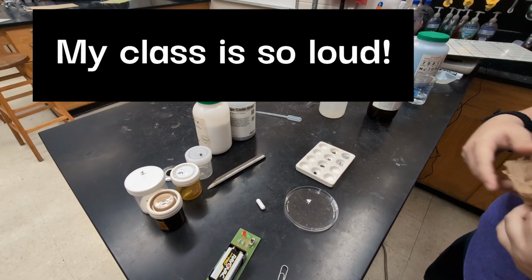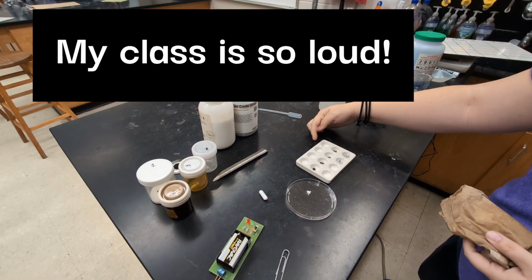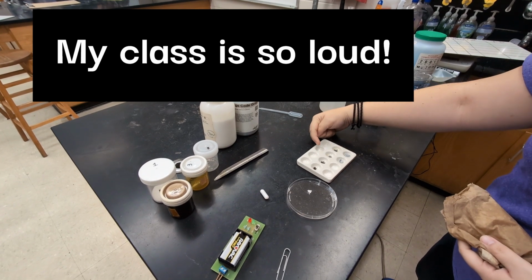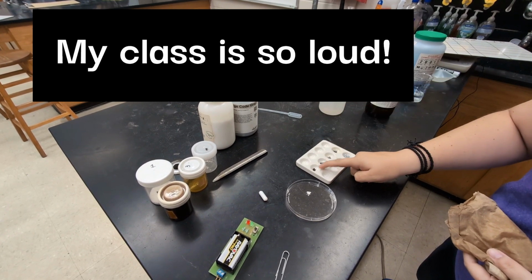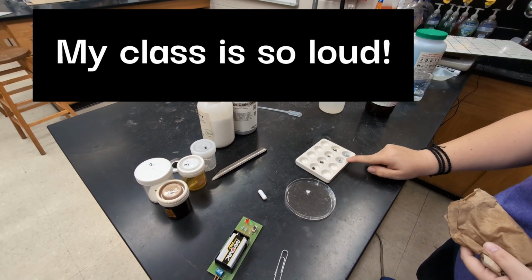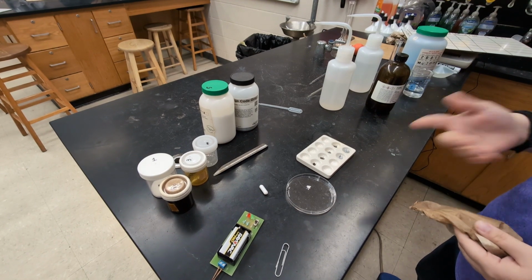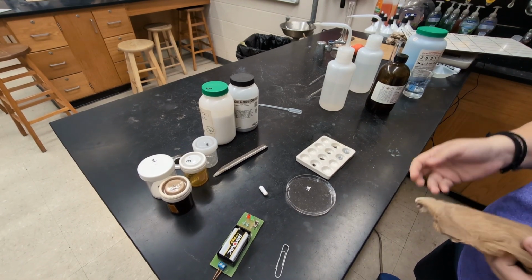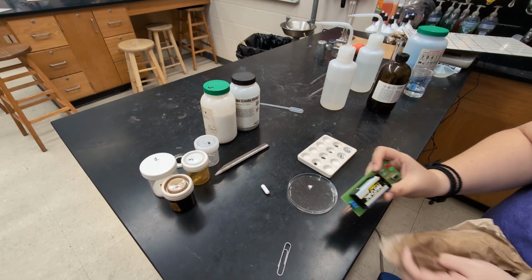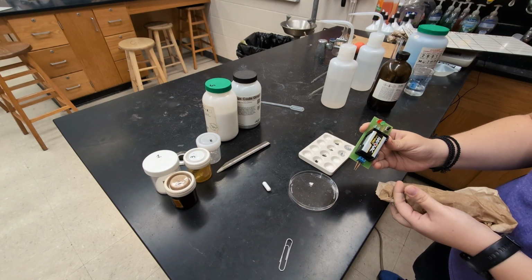Okay, so I have the 6 substances and I put each substance in 2 wells. So this is substance 1, these 2 are substance 2, then substances 3, 4, 5, and 6. Now I'm going to run it through a series of tests. The first thing I want to test is whether it is conductive as a solid. So I'm going to use this conductivity tester here, and if both of the lights light up, then we know that it is conducting electricity.